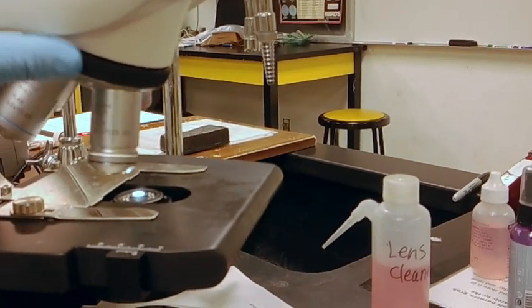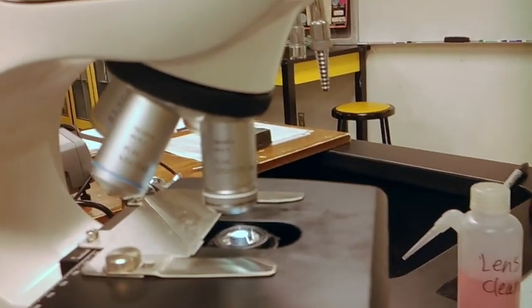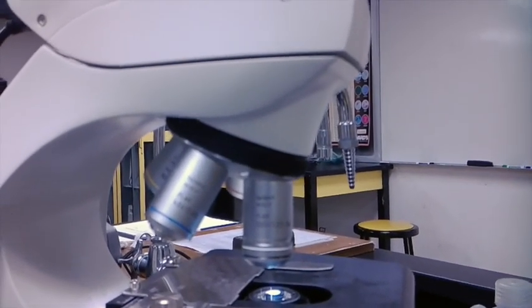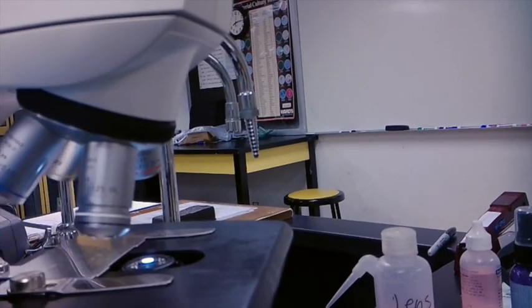All the other objectives, as you can see when we zoom in, all the other objectives, such as the 40x, so the only objectives that you're going to be using with oil will say on the objective tube itself, oil.